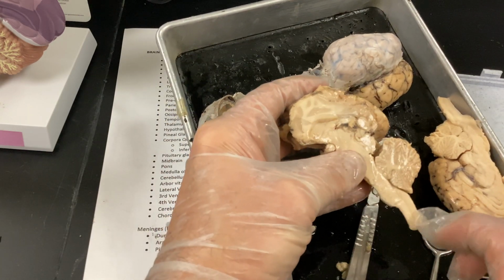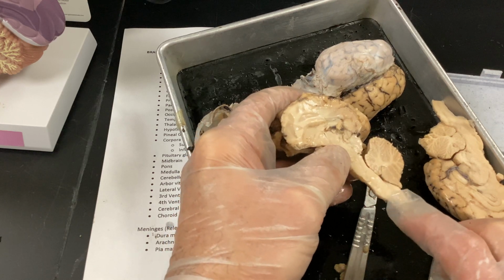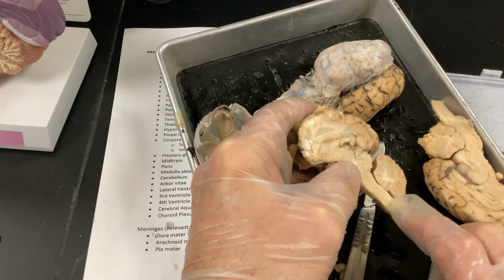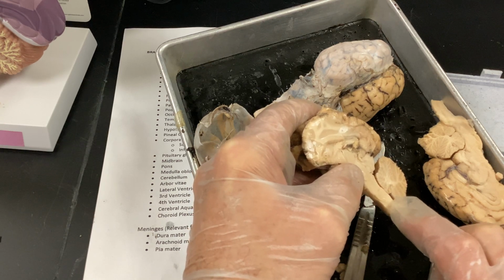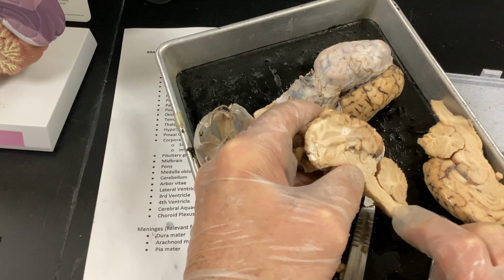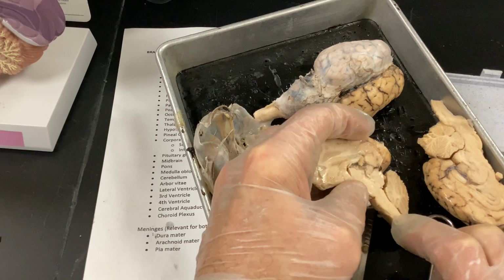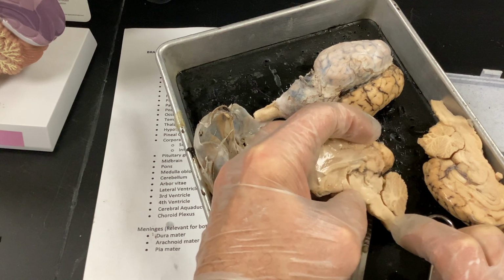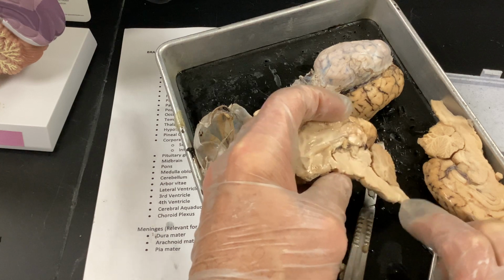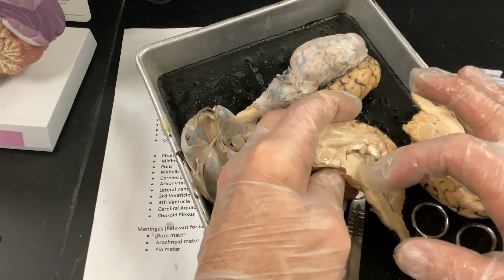And I wanted to point out, here's your brainstem. When you're asking a test question, remember your brainstem is very, very basic. So anything that has to do with surviving, whatever is absolutely necessary for life, so heart rate, breathing, dilation of blood vessels, and so on. Your base primary functions are going to be in your brainstem. And that's more like a reptilian brain.